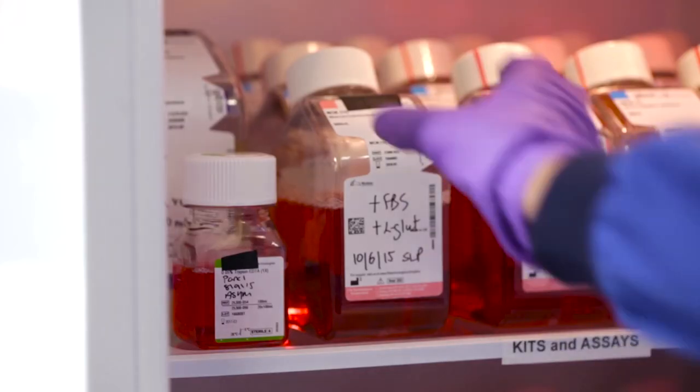Remove cell culture media and trypsin from the fridge and place in a humidified 37 degrees Celsius carbon dioxide incubator to warm.